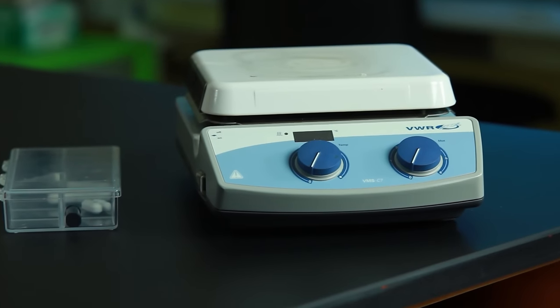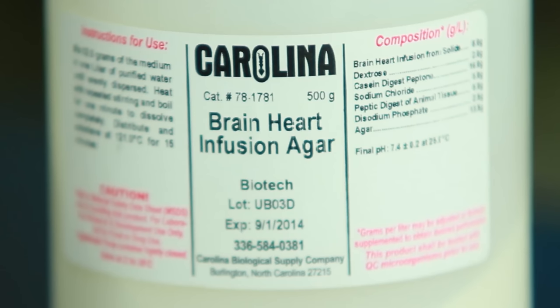In this exercise, we'll demonstrate the steps for preparing brain-heart infusion agar.